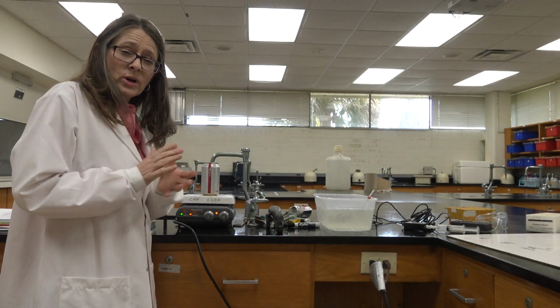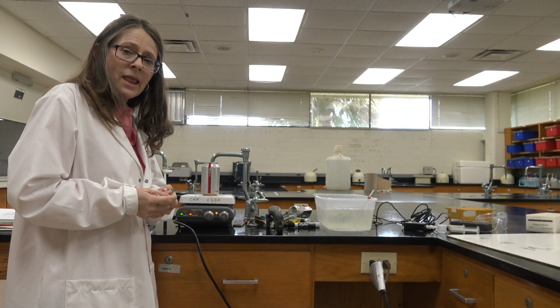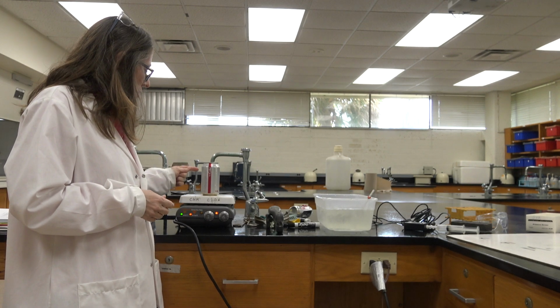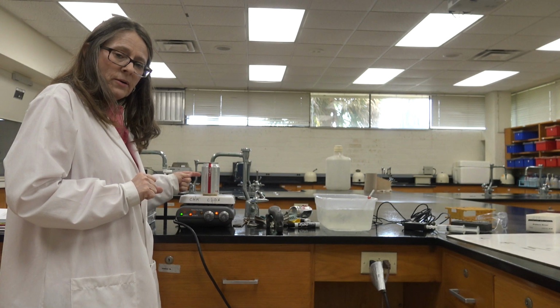You should have your notebook out. Your notebook should be filled and prepared just like we were doing this in lab, and you should be writing down this information. So the temperature of the gas, you estimate it. I'm going to let you come up with that number.